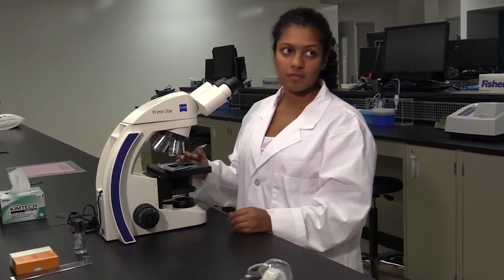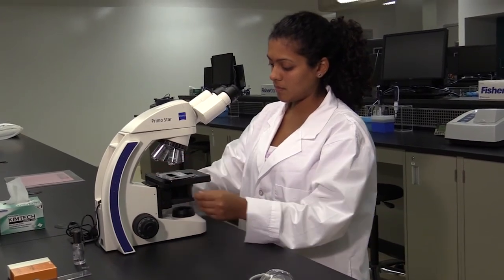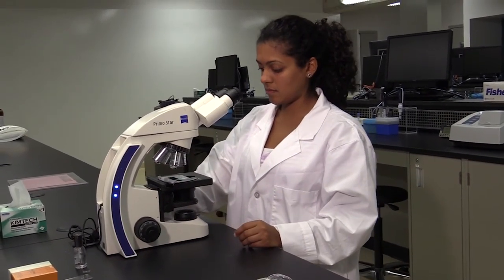In one of the final steps in Part C, examine a leaf impression under a compound microscope using the 40x objective lens.